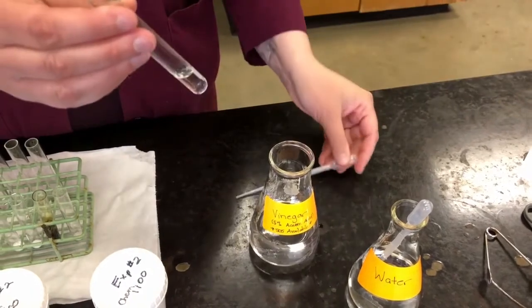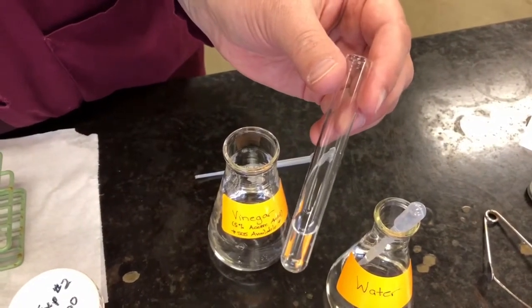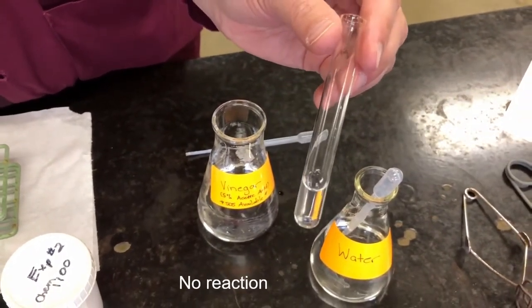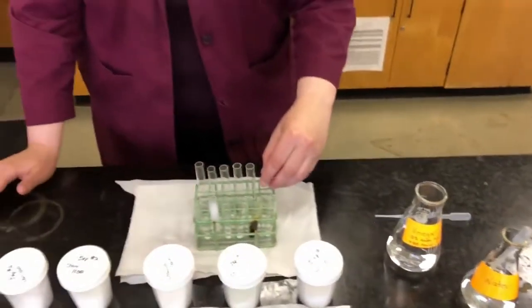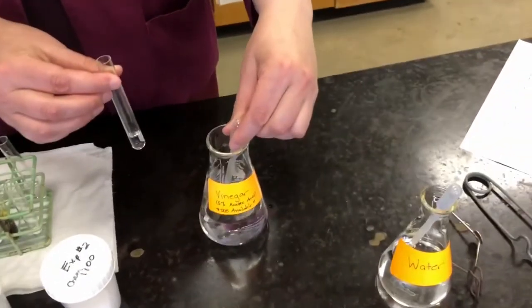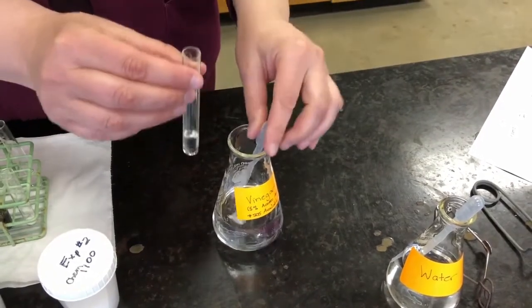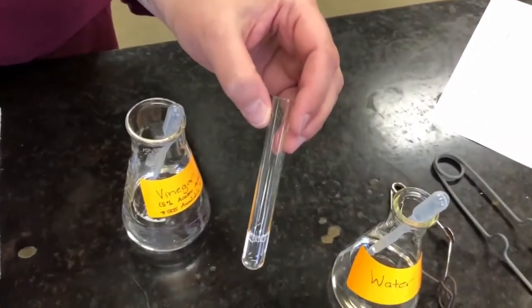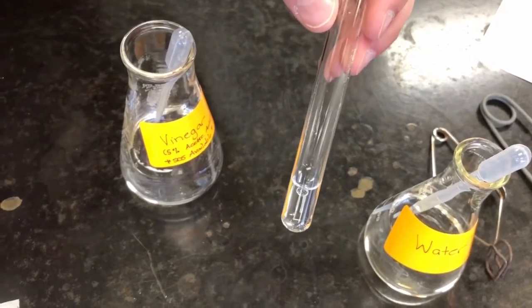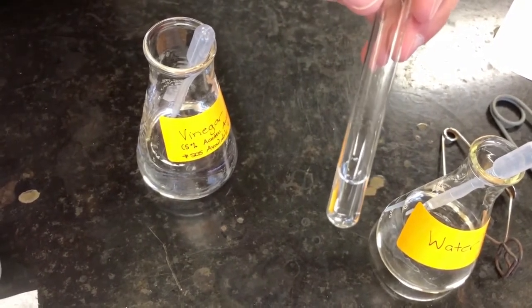And let's see if we see anything happening with the first substance, which is salt. And we don't see anything. So that means there is no reaction, there is no effect of adding acid to salt. Let's try our next substance, which is sugar. Sugar and vinegar. Those bubbles are just from me mixing it together. But do we see any actual bubbles being produced in the solution? No. So there is also no effect of acid on sugar.